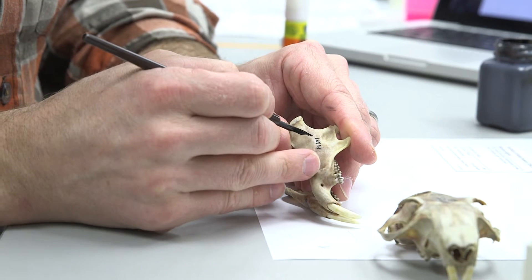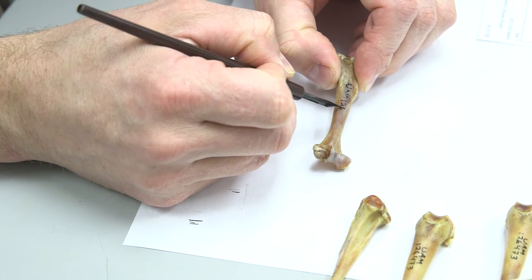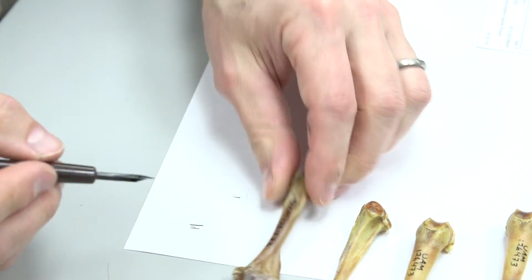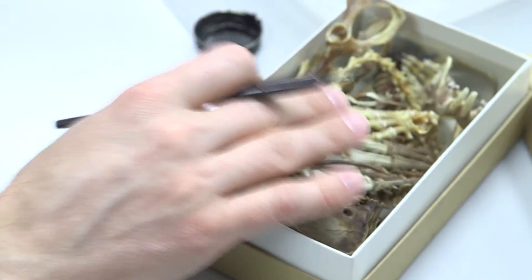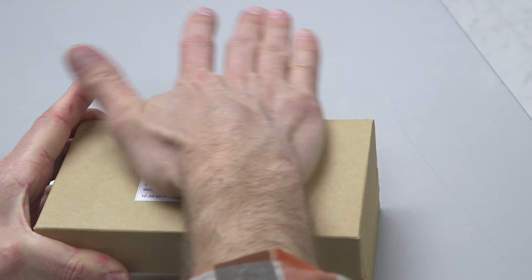After about 24 hours in ammonia, the skeleton is completely clean. We apply a catalog number to each bone to ensure that the bones will not become lost or mixed up with other bones from other individuals as they are examined by researchers. We add a data label to the skeleton box and the specimen is ready to be installed into the collection.